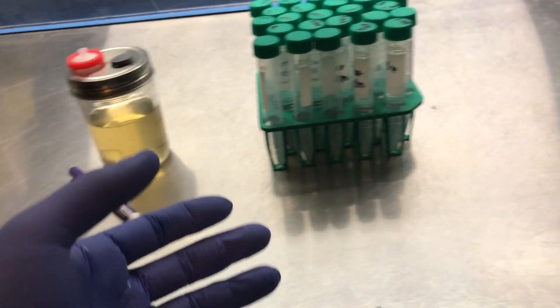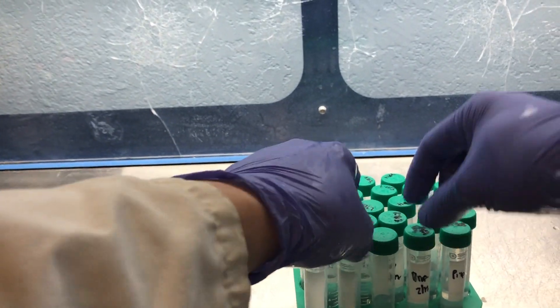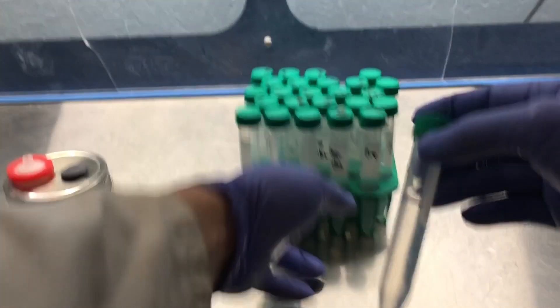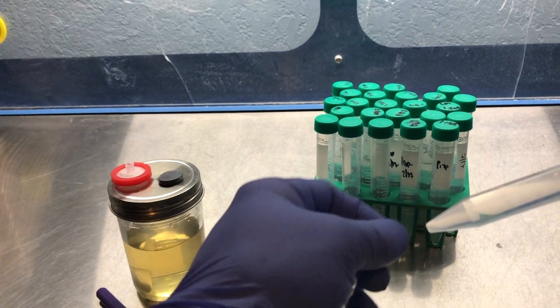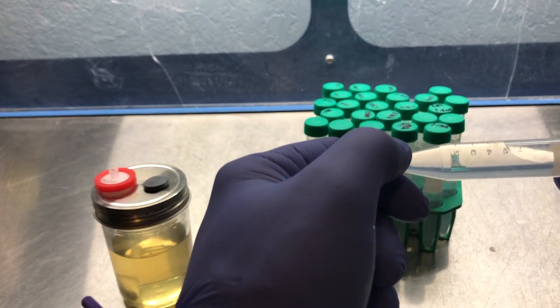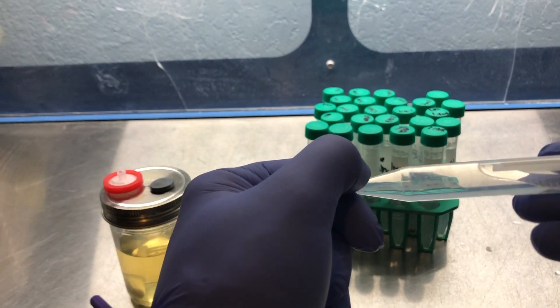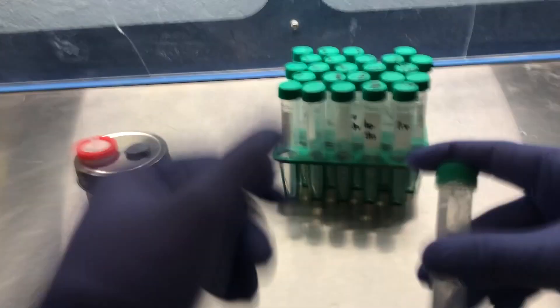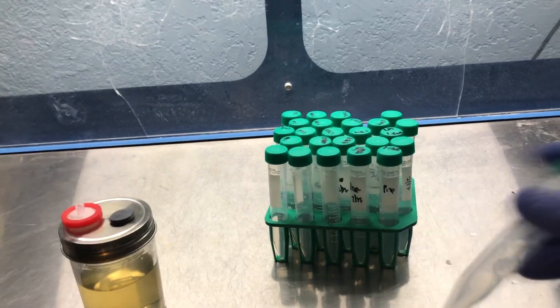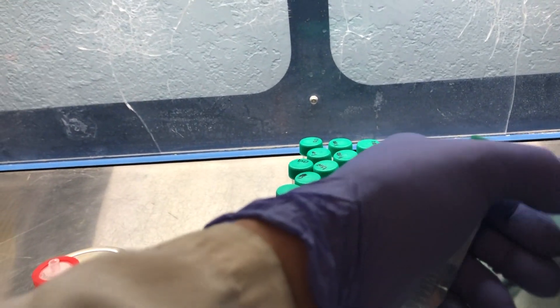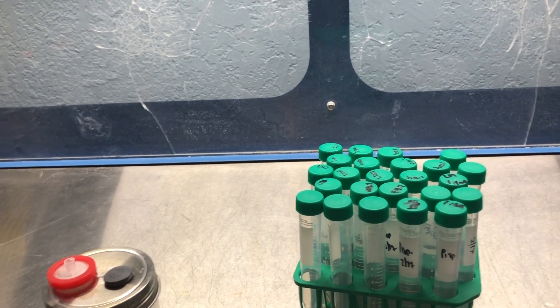Alright, so I've got my hood cleaned out and now I'm going to be taking my 10 to the 4th dilution of the black pearl king oyster. You can see that there's quite a bit of spores still in solution. I'm just mixing it around right now. It's always good to give it a thorough mix. You can use a vortexer, this helps a lot, or adding surfactants as long as they're sterile and they won't harm the mycelium. Tween 20 is a pretty good surfactant.